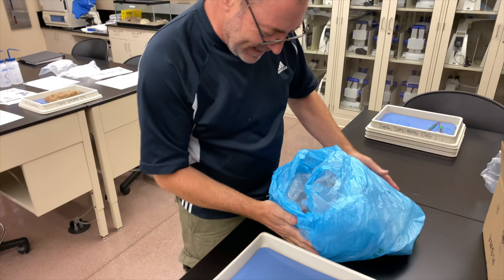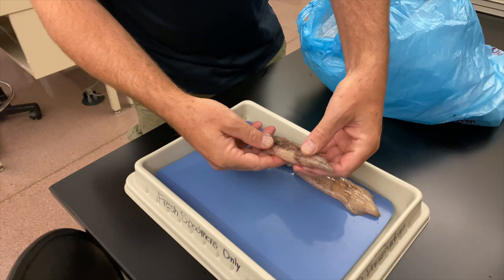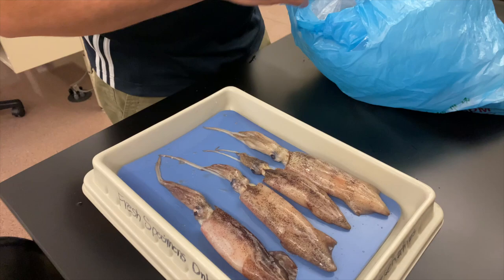If only you could smell what I can smell. Okay, this little lovely — oh yeah, one of those, and one of those, and one of those, and one more. Oh, look at these — guess what I'm gonna have for dinner tonight! Okay, and there's more.